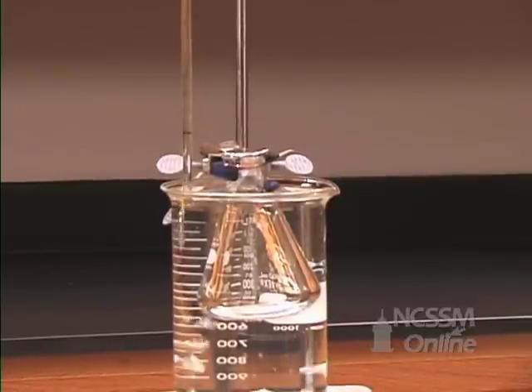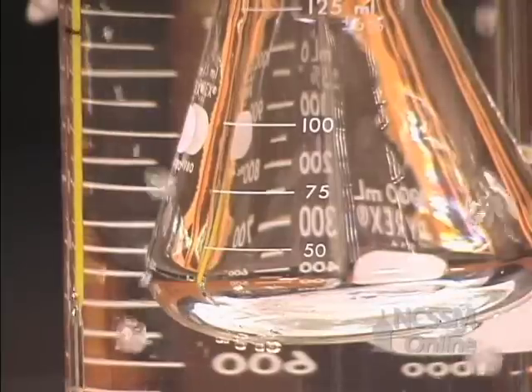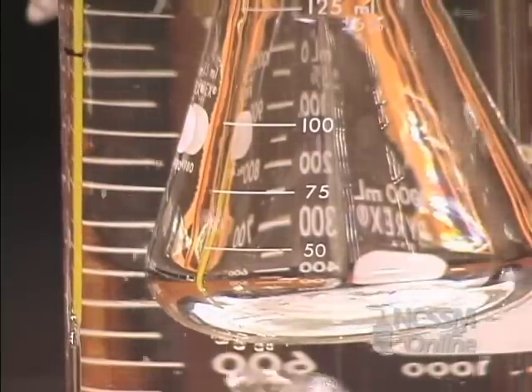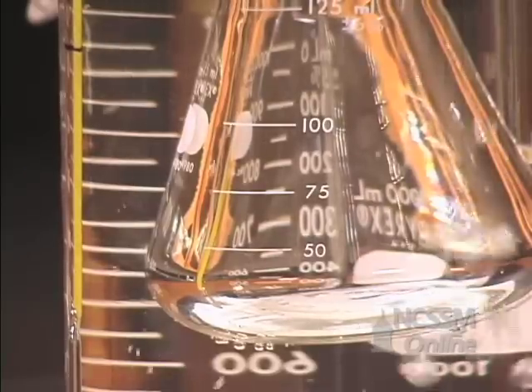Eventually, all the liquid vaporizes and the flask is filled with just enough vapor to fill the flask at the temperature of the boiling water.